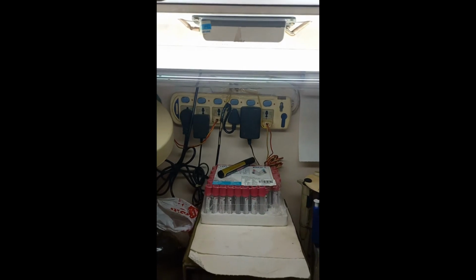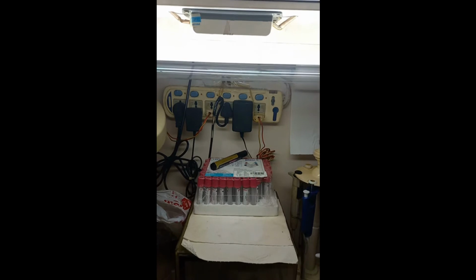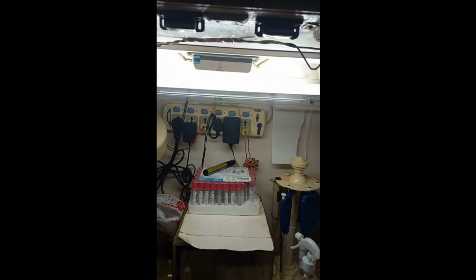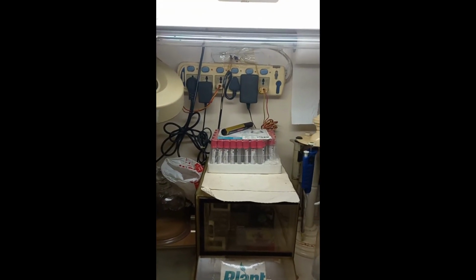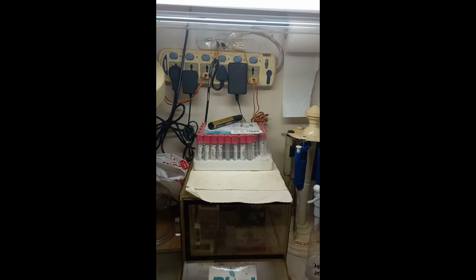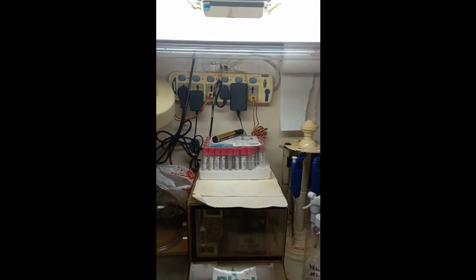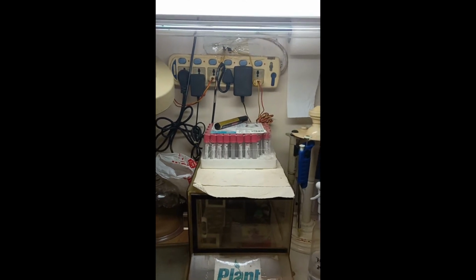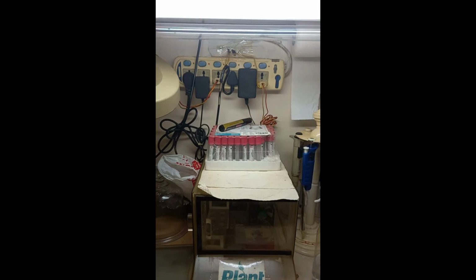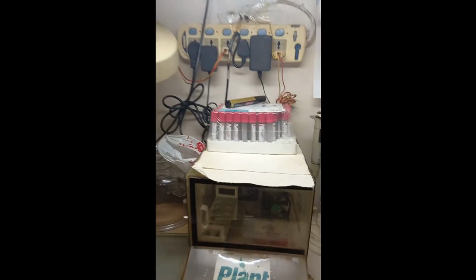This is also necessary to keep the cabinet sterilized. When you finish the work, or just before the work, you have to switch on this UV light, which I am going to switch on now. This light should not be visible when the cabinet is open, because only when you close the cabinet can you switch on the light. That will give you a violet UV light, so you can sterilize or disinfect the cabinet.